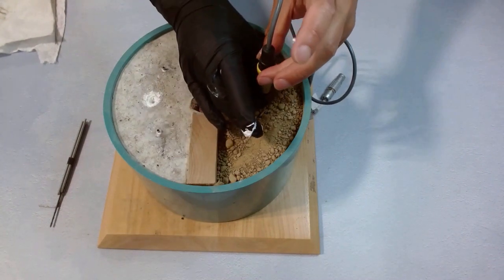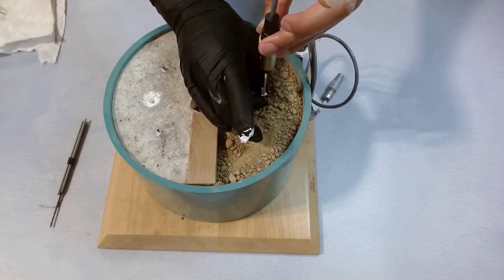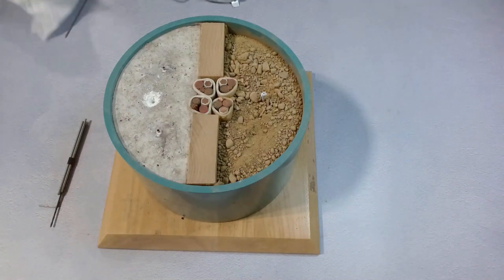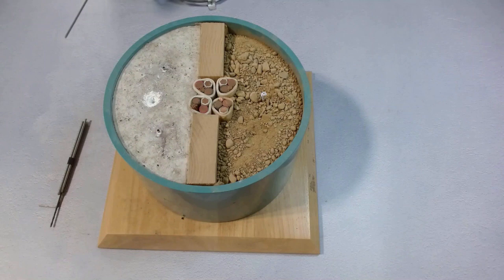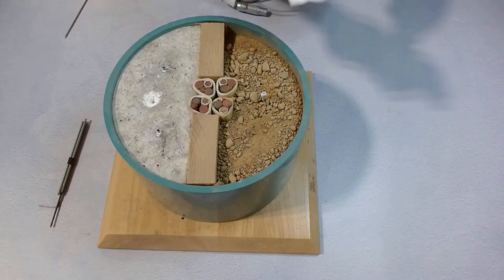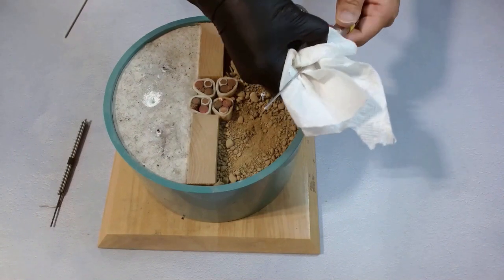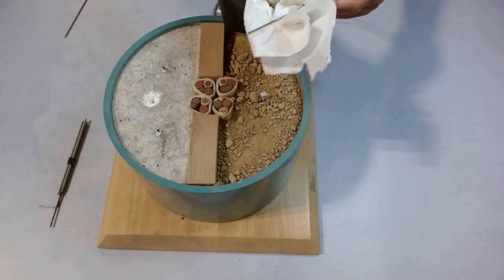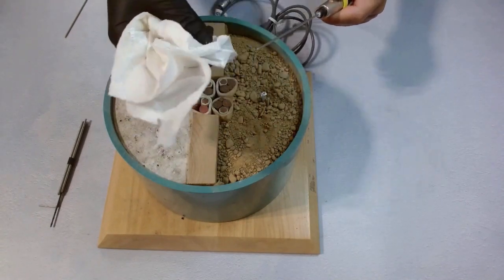After the test, we gently pull the needle out. It should be pretty easy pulling out from the sleeve unless we leave it in there too long and the paste dries. We wipe the needle body clean. Never leave too much paste on this because over time the paste will dry and become quite hard to clean. If you wipe it too hard, there's also risk of bending the needle and breaking the sensor inside.